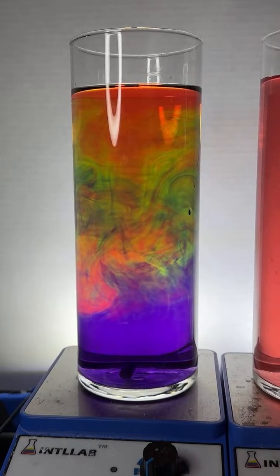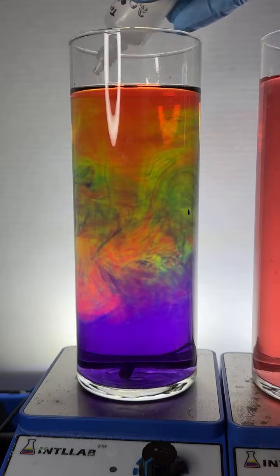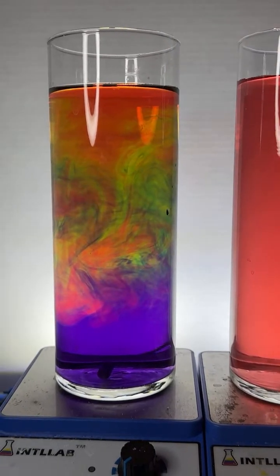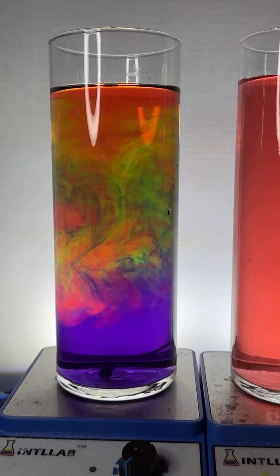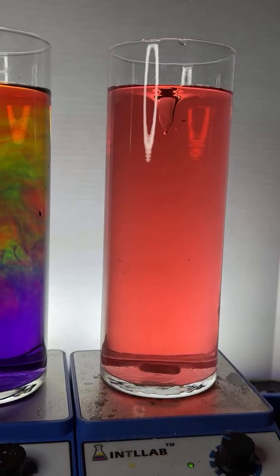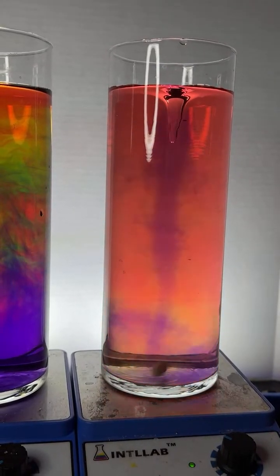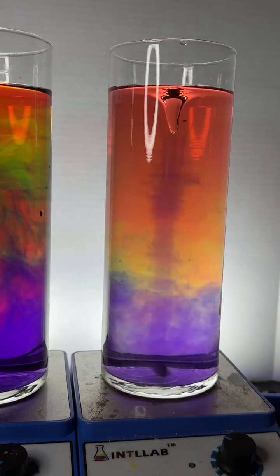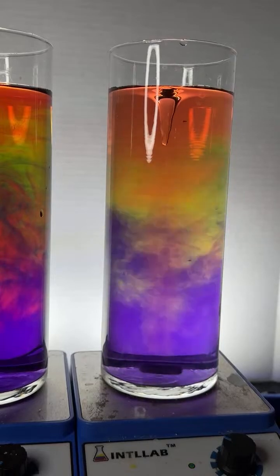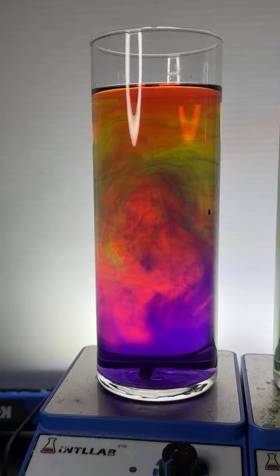It gives us a nice little effect. I'm going to add 2 more drops of acid over here. Give us a little more red in here. 1, 2. Let's see what happens. It's gorgeous. And while we're letting that develop, I'm going to go ahead and put a few drops of base in here. Let's see if we can catch the rainbow. Come on, baby. Give me a rainbow. I think we got it. We got the dynamic rainbow on the right and a more static rainbow on the left. That was cool.